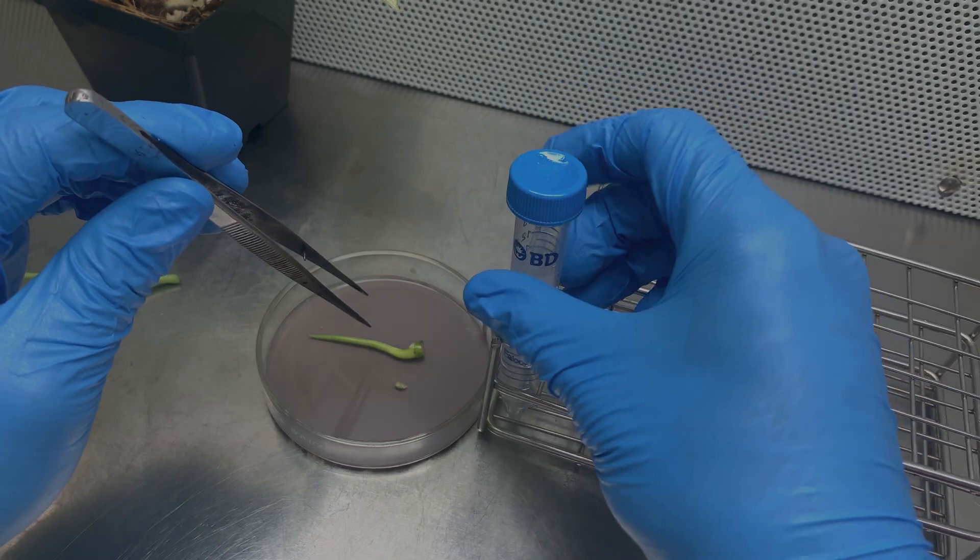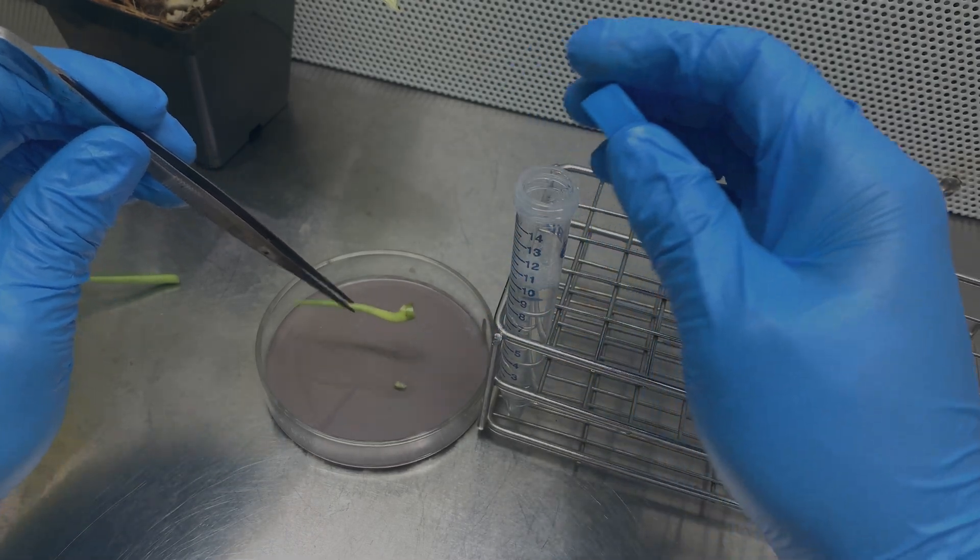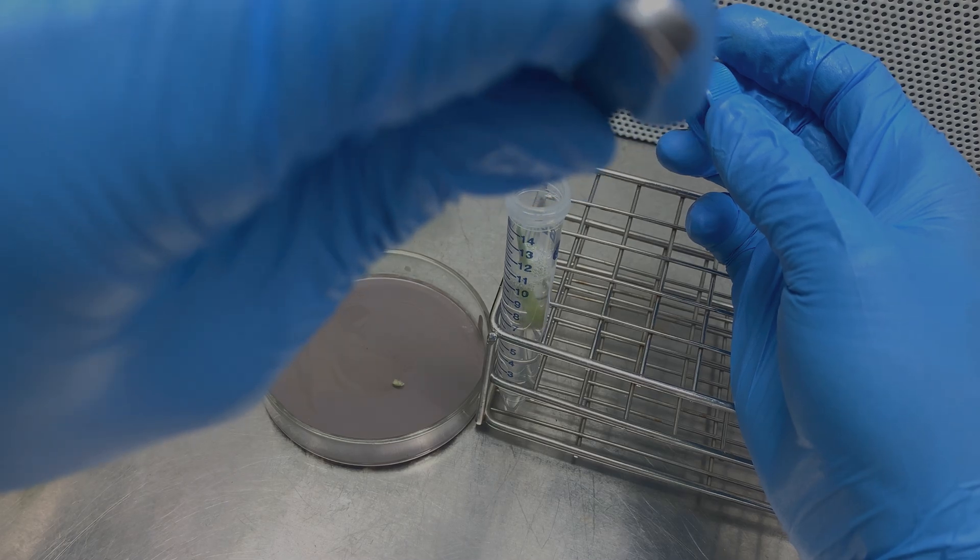I'm going to open my test tube and place my plant in. There we go.